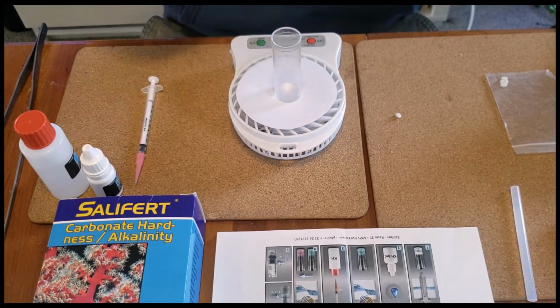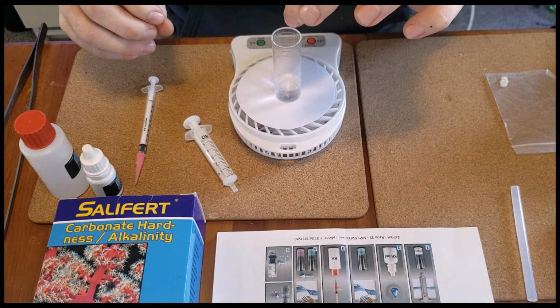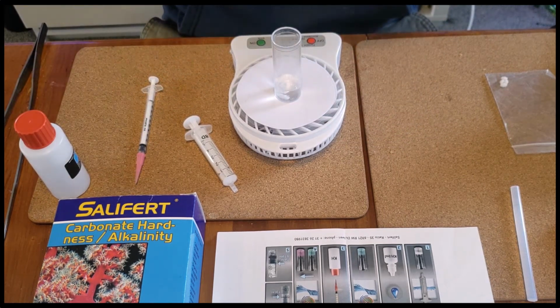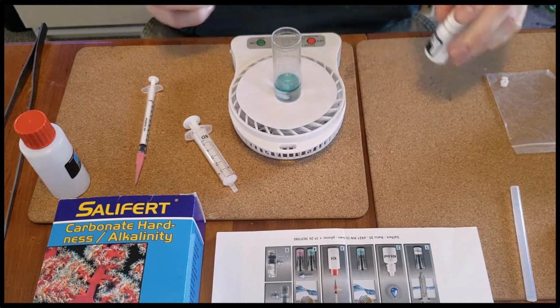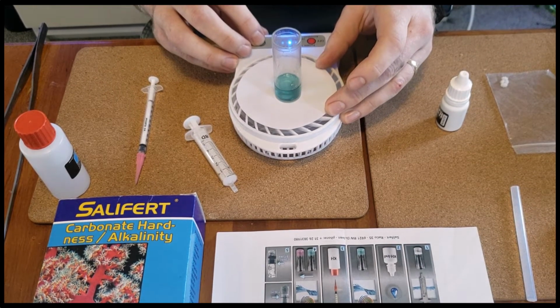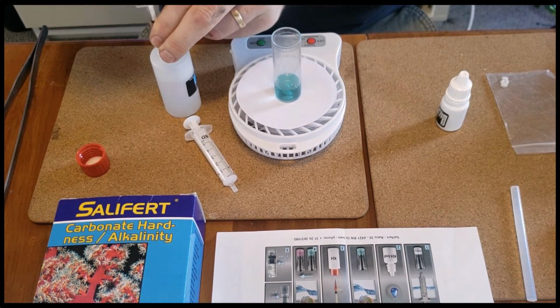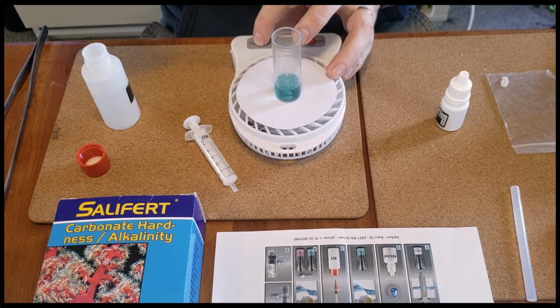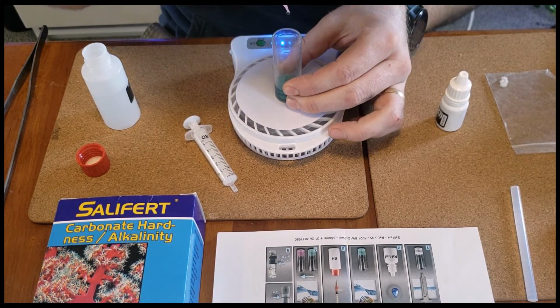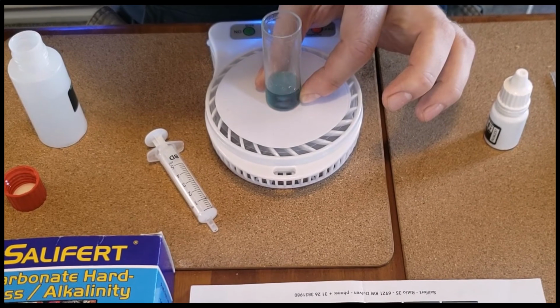To show how easy, I'm going to quickly do a KH test on my aquarium water using this new fan-based titration mixer. Once we've got our solutions all sorted, it's time to get the titration 1ml syringe. And we're just going to zoom in a little bit just to show you how well this thing mixes.